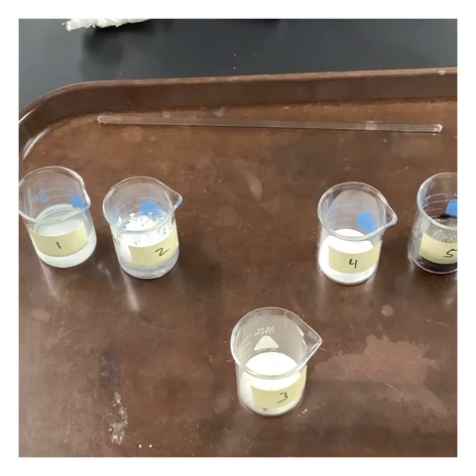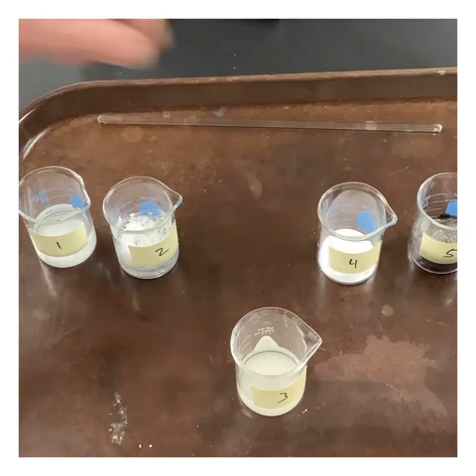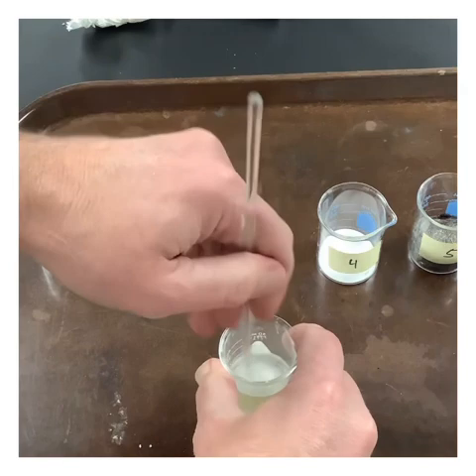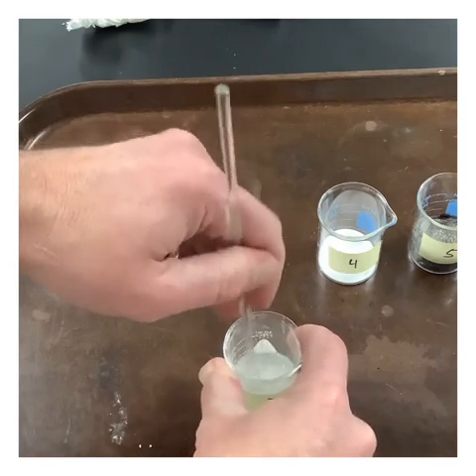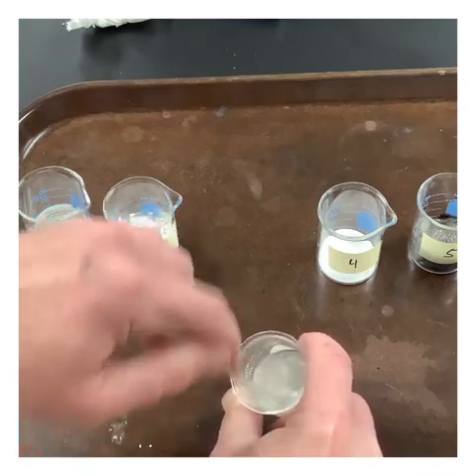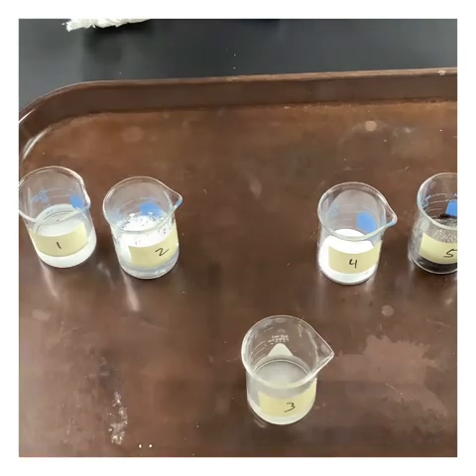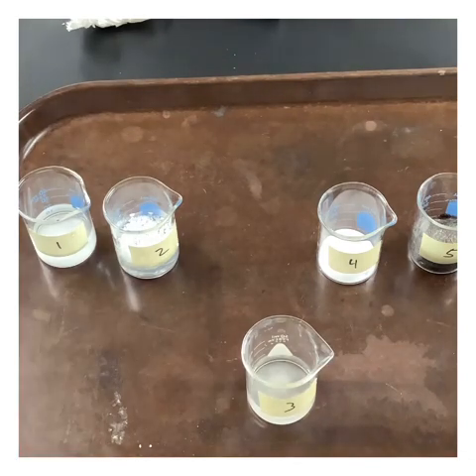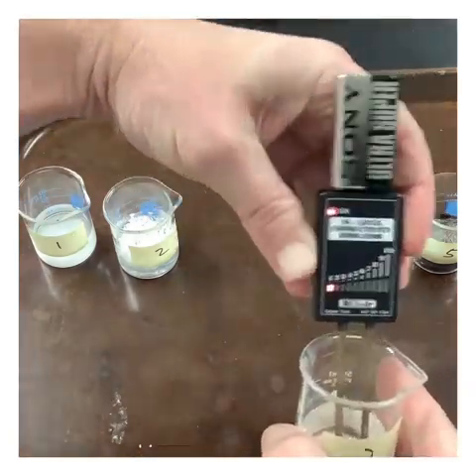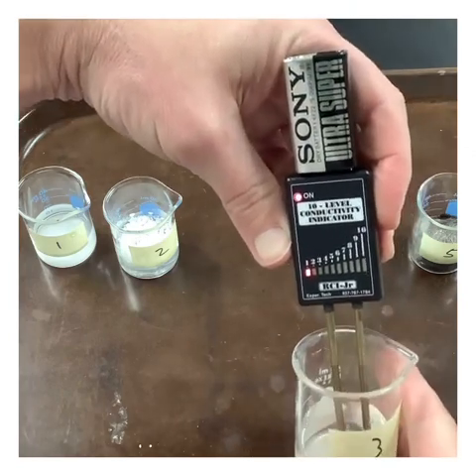Let's get some water into it. Okay, so this one looks like we're getting a teensy, oh, kinda. Can't make up its mind.